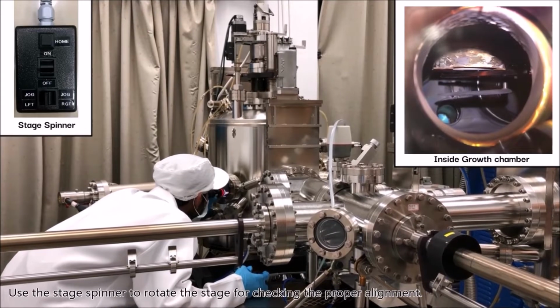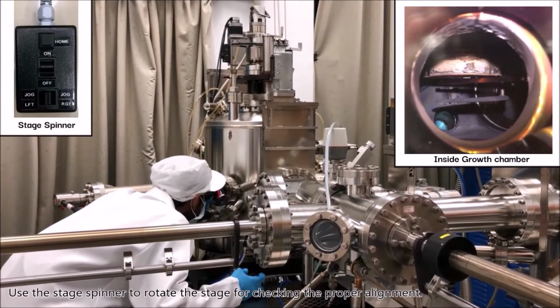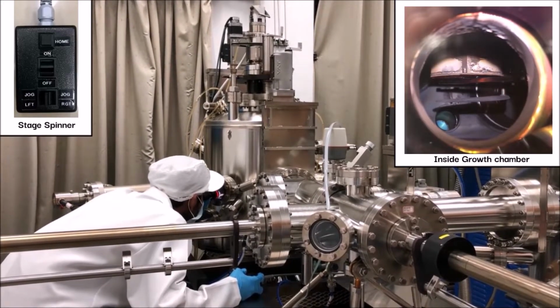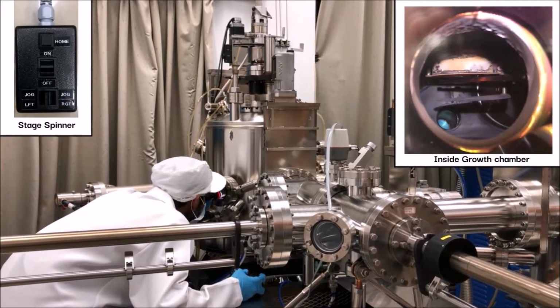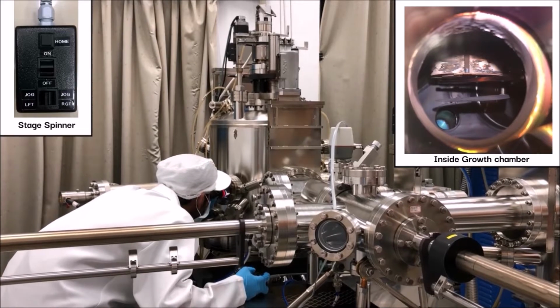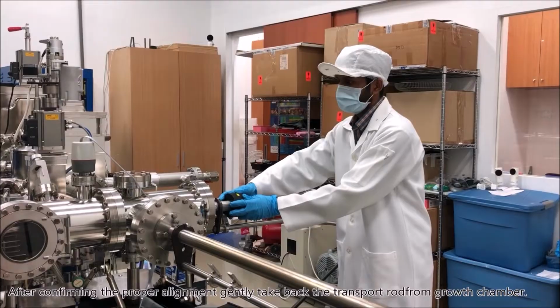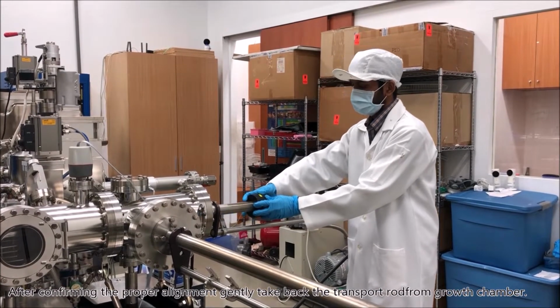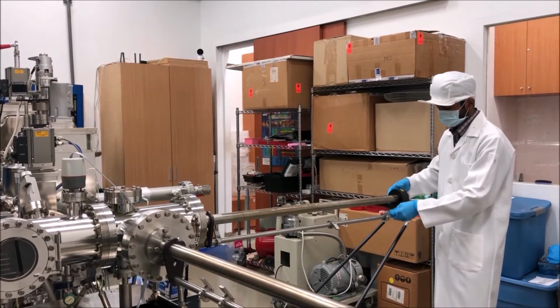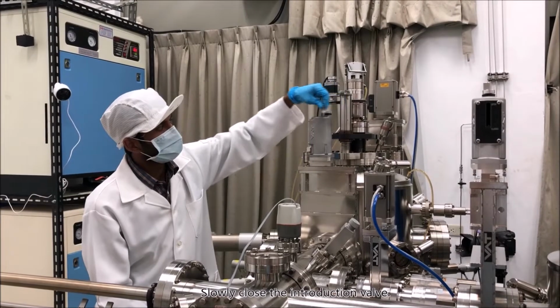Use the stage spinner to rotate the stage for checking the proper alignment. After confirming the proper alignment, gently take back the transport rod from the growth chamber. Slowly close the introduction valve.